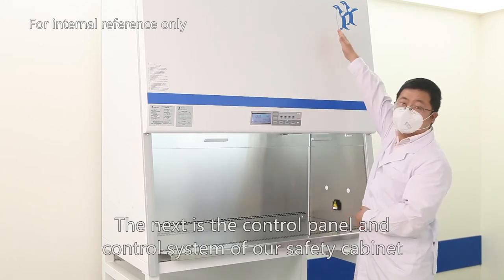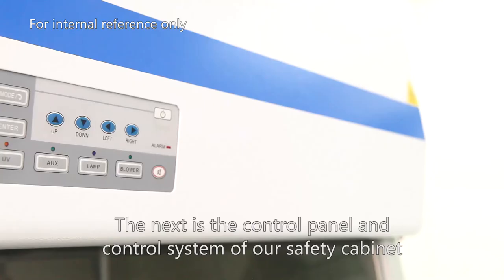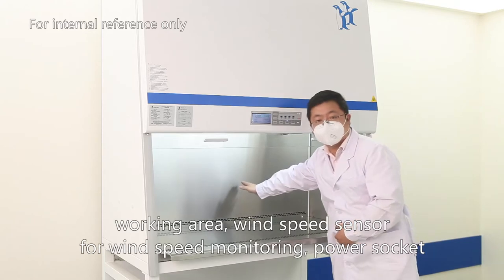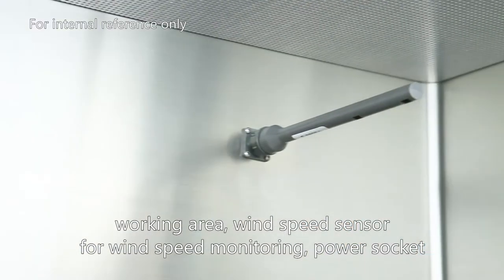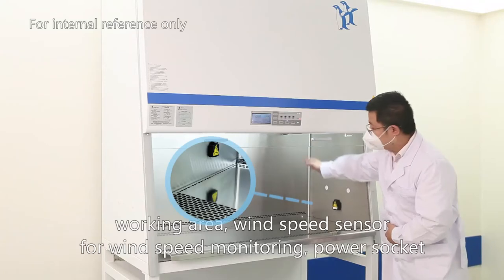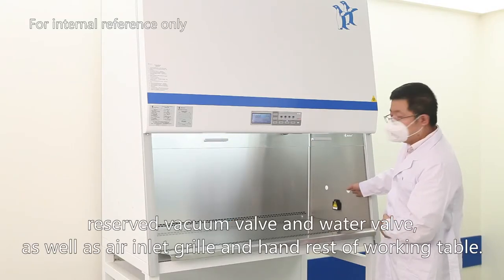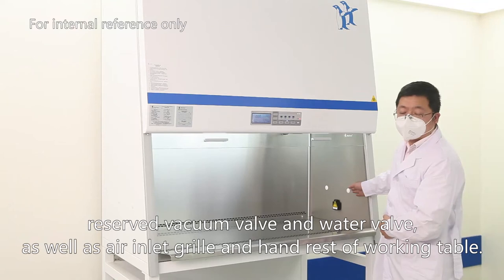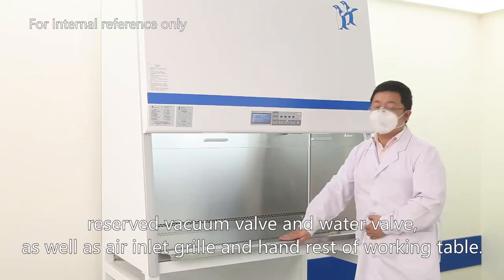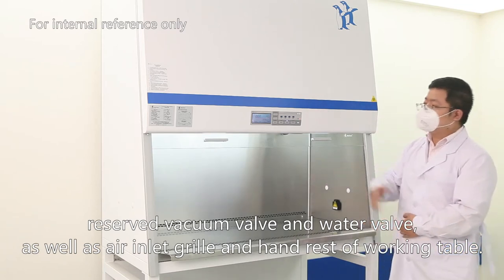The next is the control panel and the control system of the safety cabinet, the working area, wind speed sensor for wind speed monitoring, power socket, reserve vacuum valve and water valve, as well as air inlet grill and hand rest of the working table.